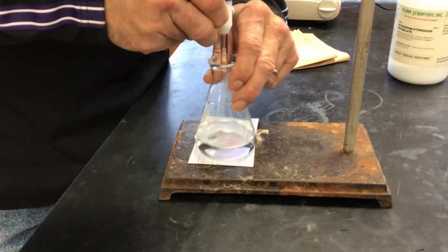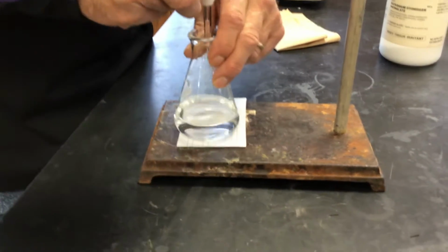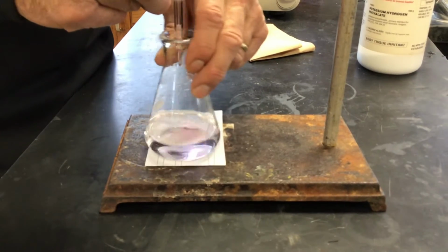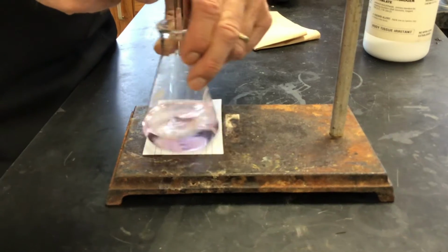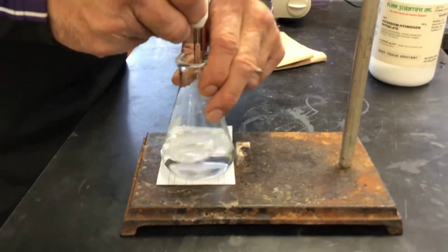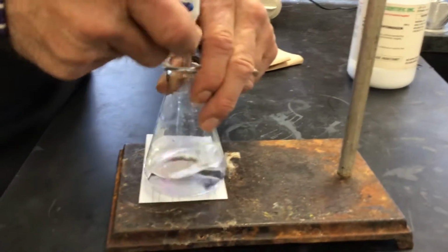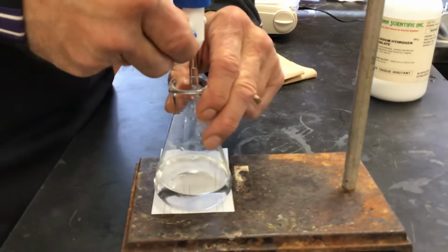Okay, we should still have a little ways to go. I'm going to try to be a little more careful. Oh boy, we've got to be close. One more drop. Come on. No, not yet.